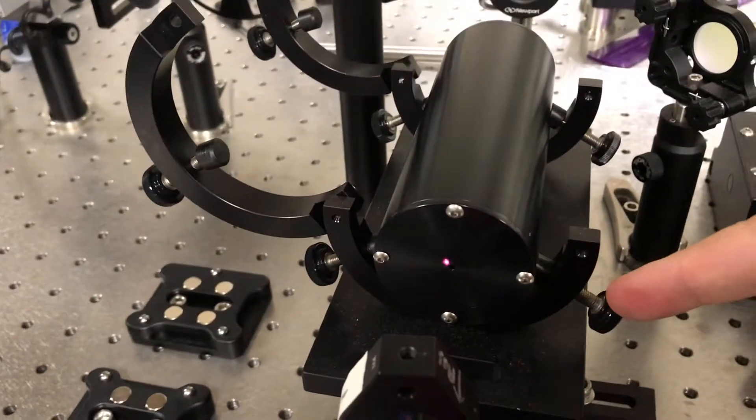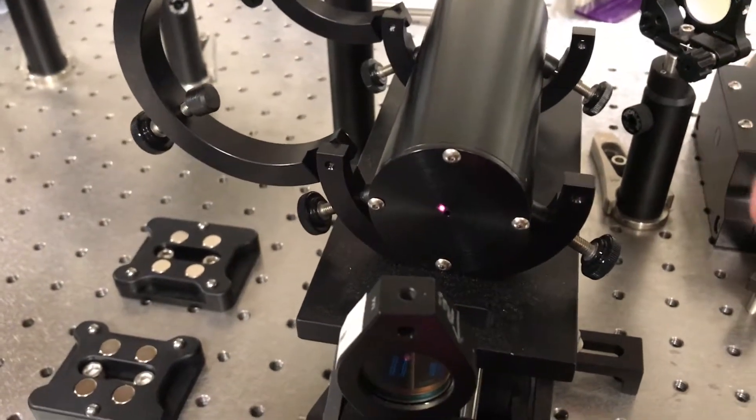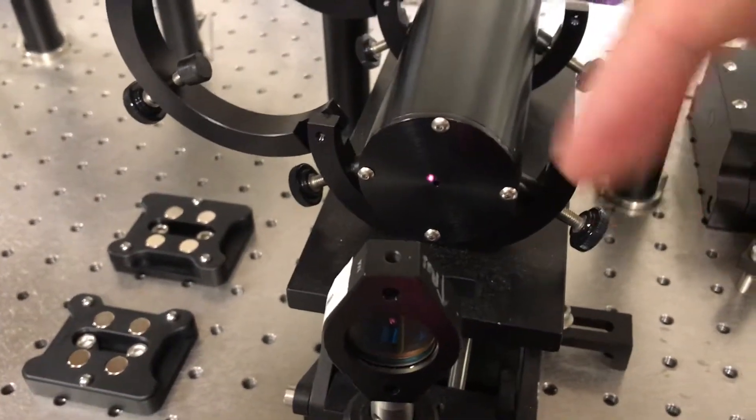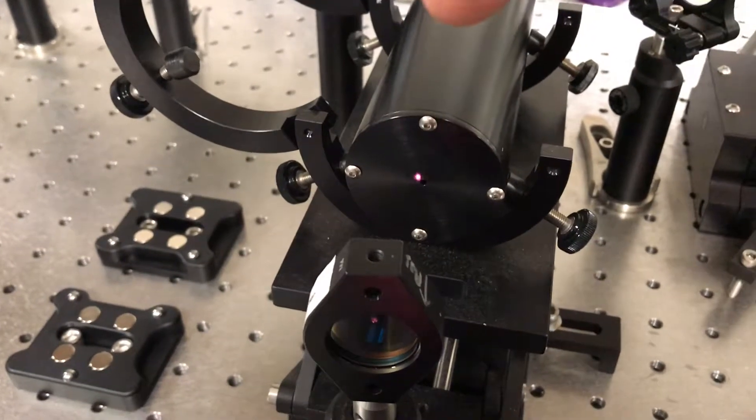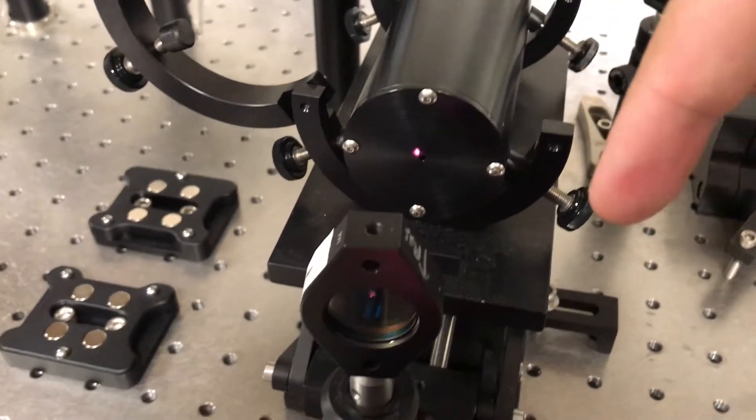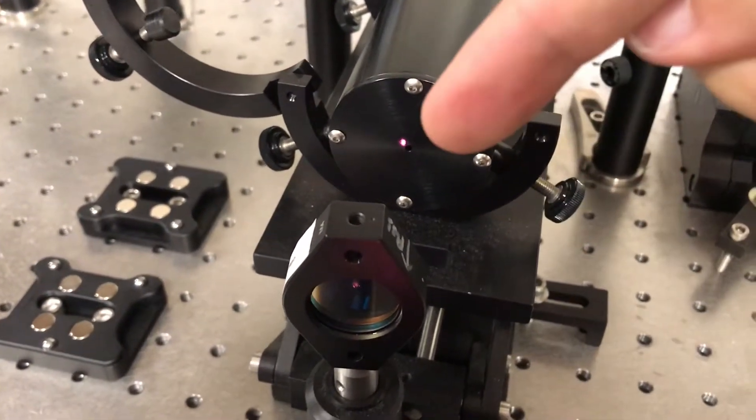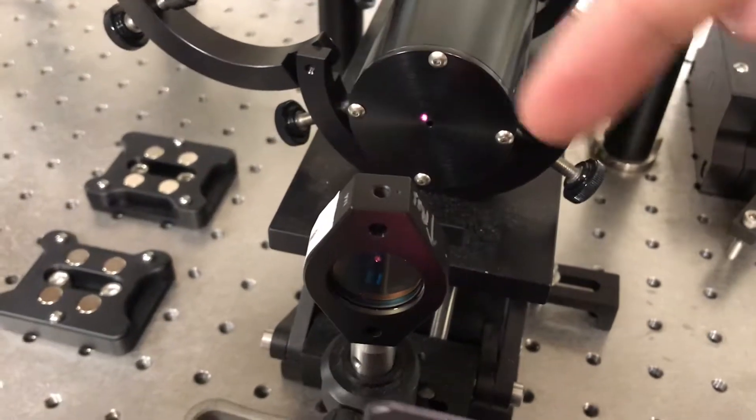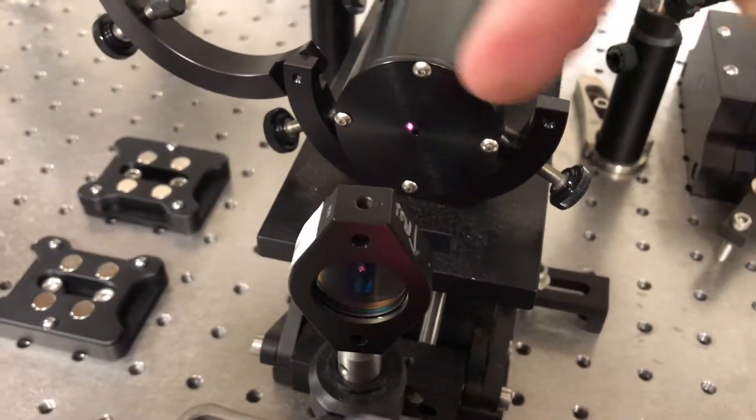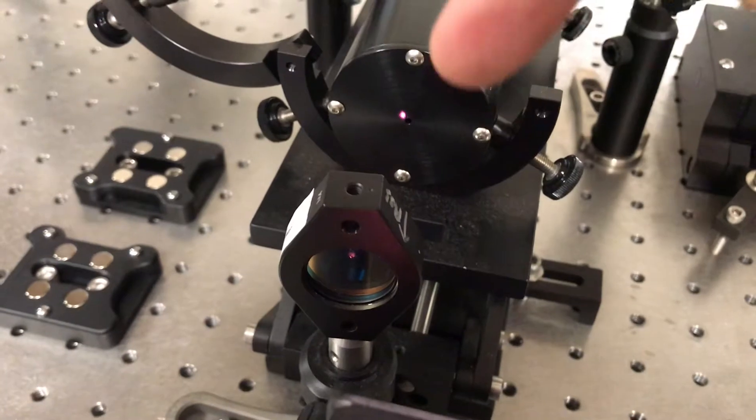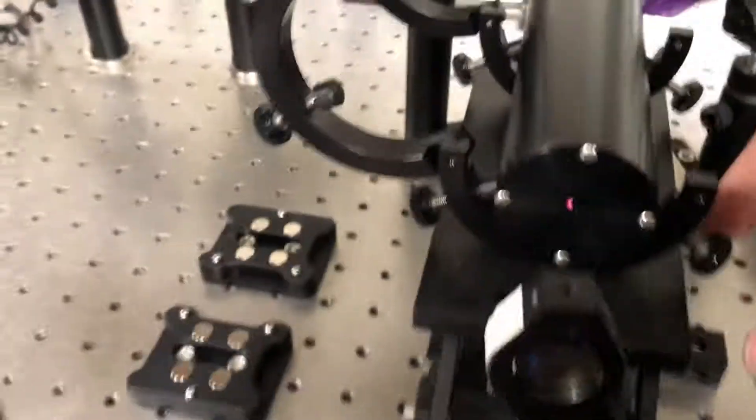So what I'm going to do is I'm going to mess with these two screws. So if I screw in both screws, the effect is basically to lift this piece up. If I screw in only one of them, basically it pushes it over and up. So I can basically have two degrees of freedom to get a two-dimensional movement of that beam.